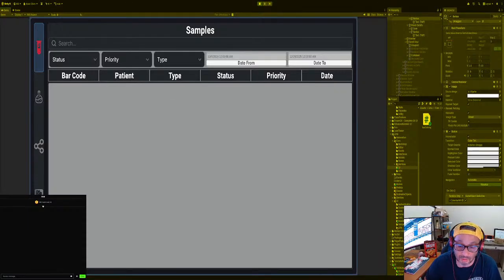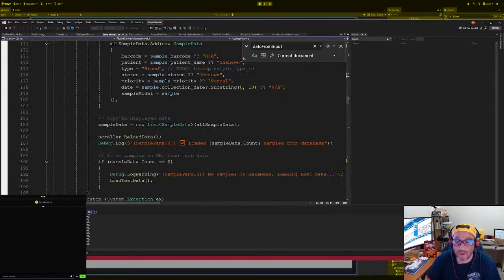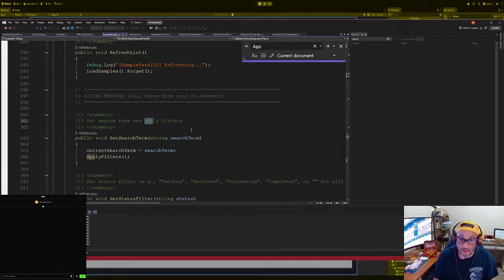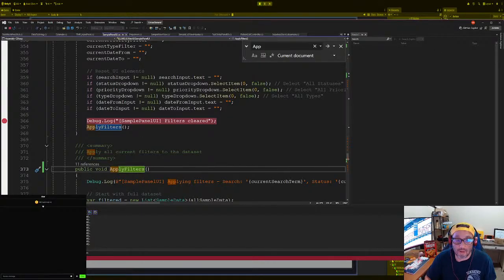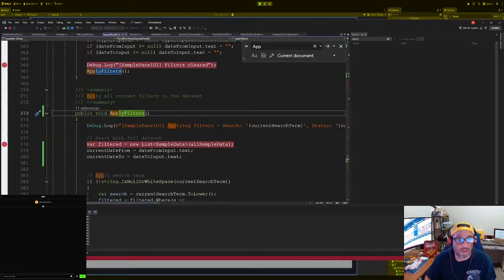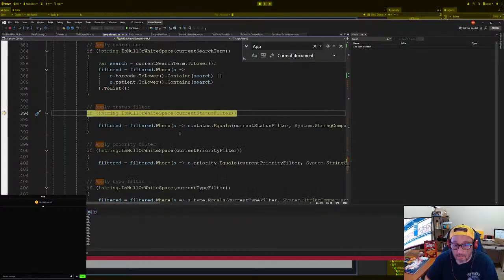No, that didn't work. So we have to go into the code base, I mean the script, and see what's going on. So apply filters. Okay, first of all, are we applying the filter? Yes, okay, so that, apply filters, right? The search terms, apply filter, make sure that's working correctly. Right here. Okay, and so we go here from, there we go. So let's see, we are going here. No, okay, so it's fine.